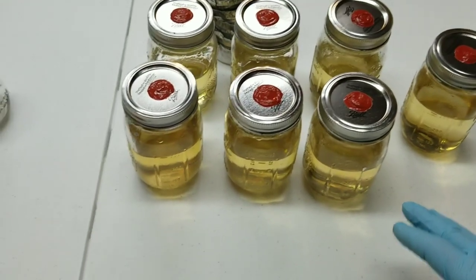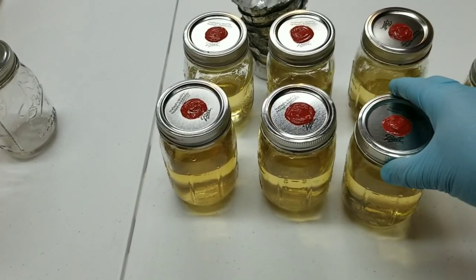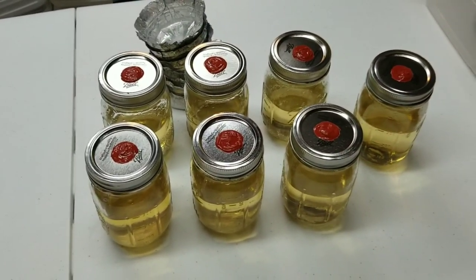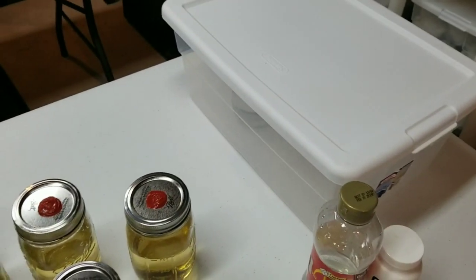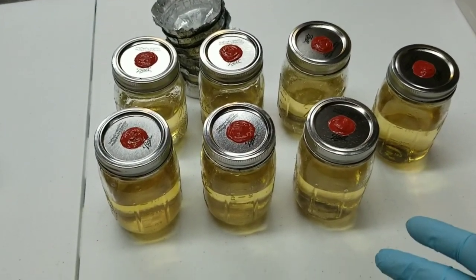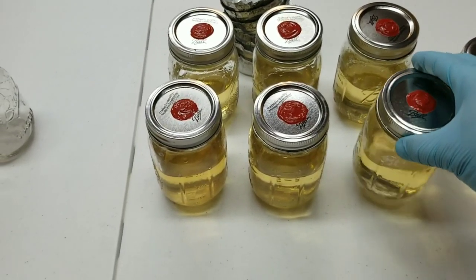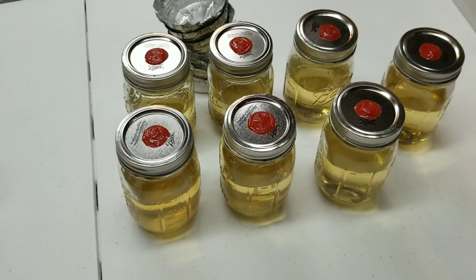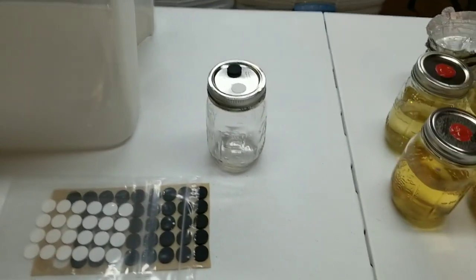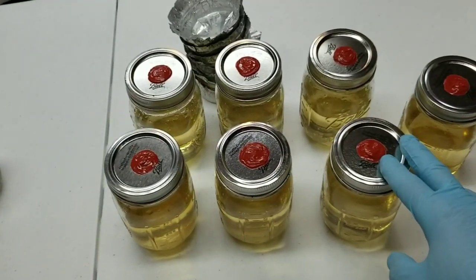I typically use 18-gauge syringes with these non-vented lids and it works fine. These are going to be master jars that I store in a tub in the refrigerator, and whenever I need to inoculate grain or start another liquid culture jar I'll pull from my master jars. There are two types of injection ports I've had a lot of luck with, and I'm trying to save you guys some headaches because I've tried a lot of different products.